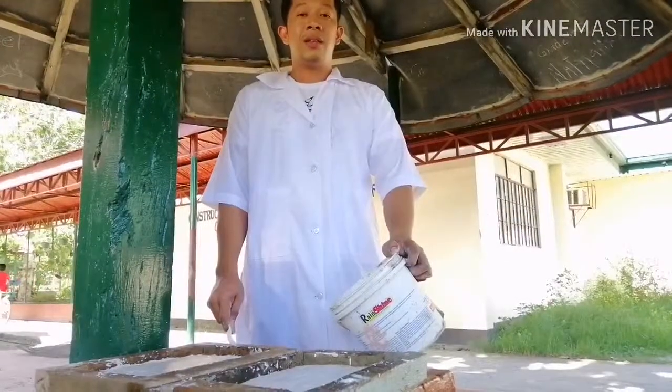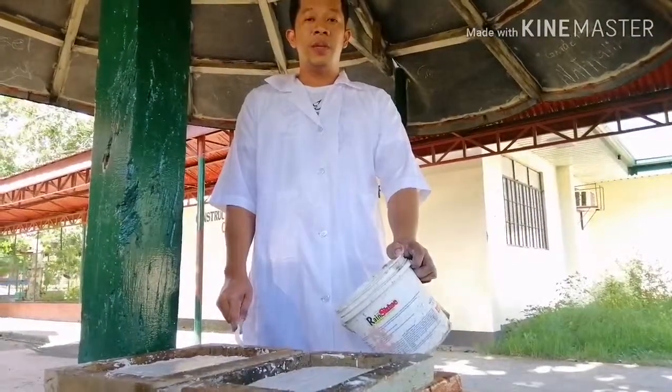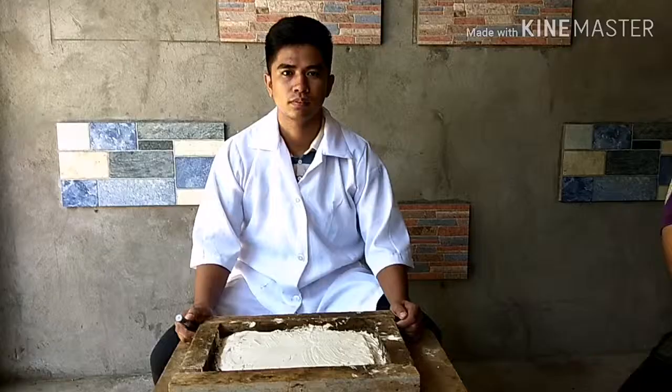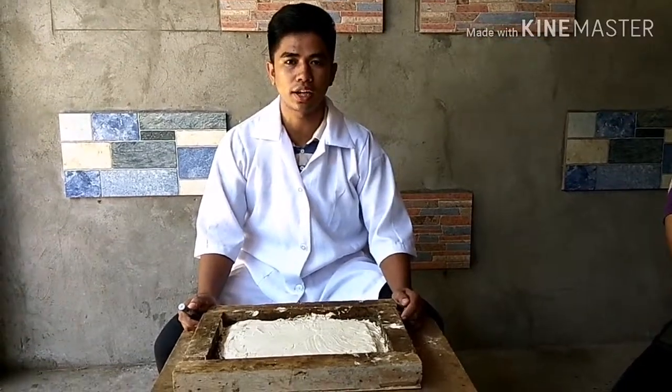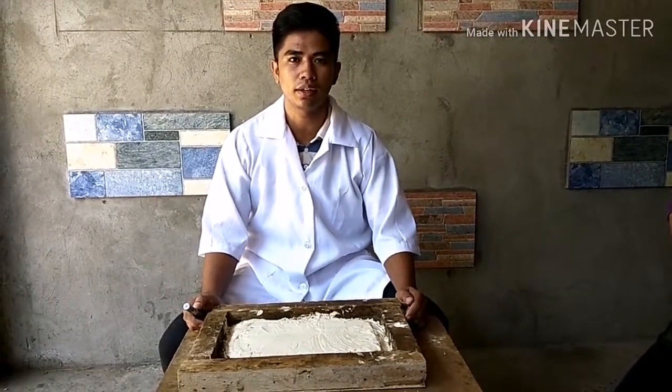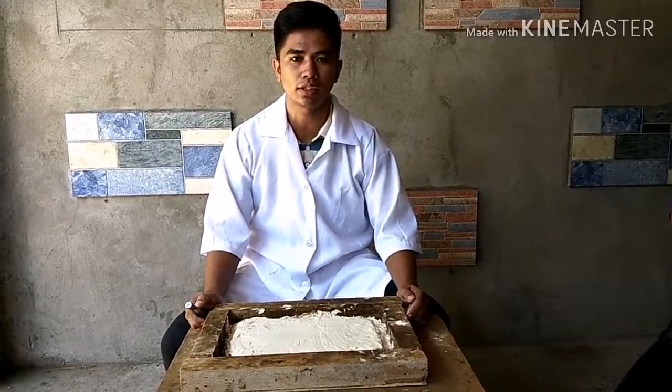Now that the last coating has been applied, we are just going to wait for it to dry. Now that the cast is dried, we are now going to label and harvest it.